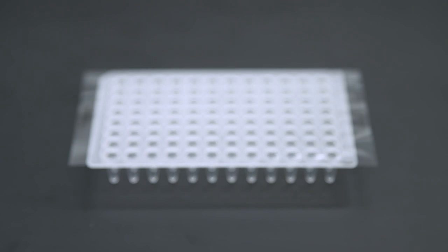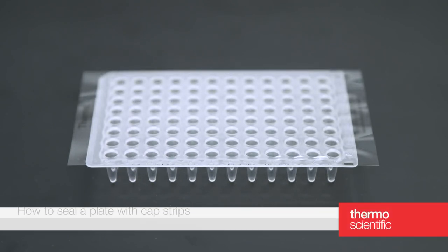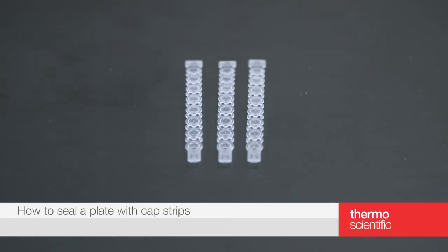Your plate is now securely sealed with adhesive film. You can also securely seal a plate using cap strips.